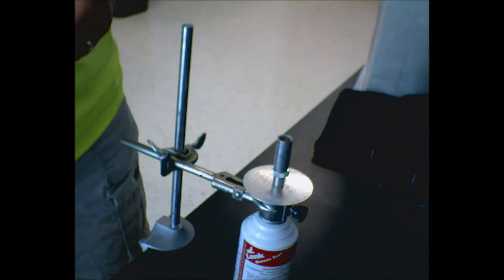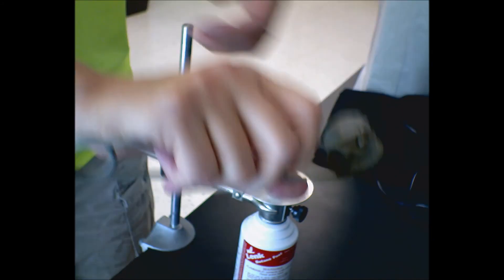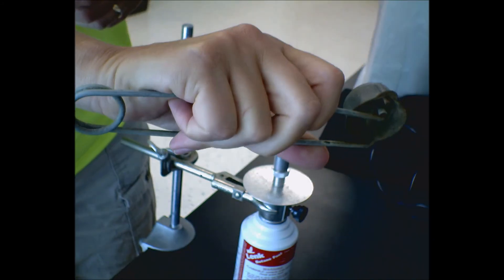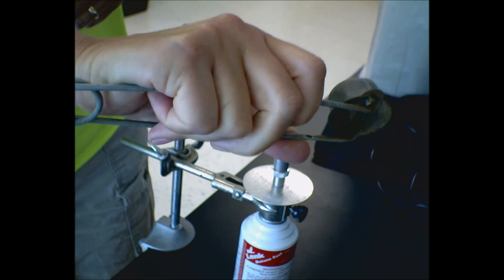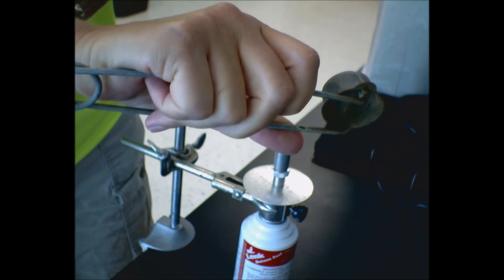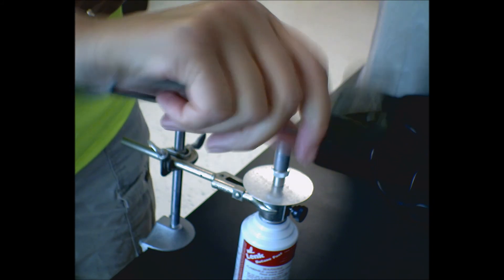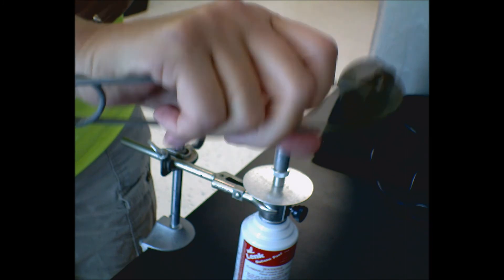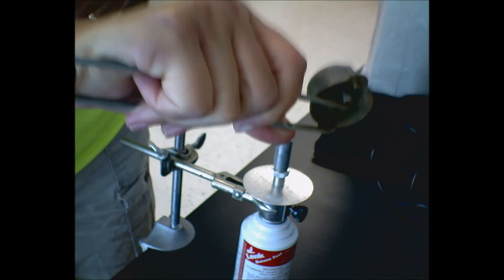So you're pushing down, but you also make sure you push in so that you get it to spark. If all you're doing is pushing across, you're not going to get much spark. You've got to make sure there's some tension going down and across.